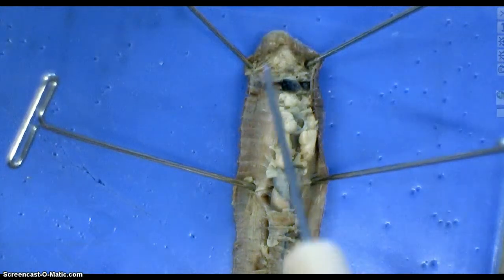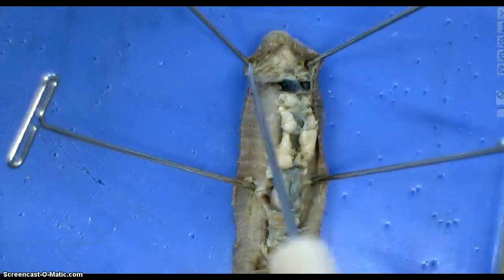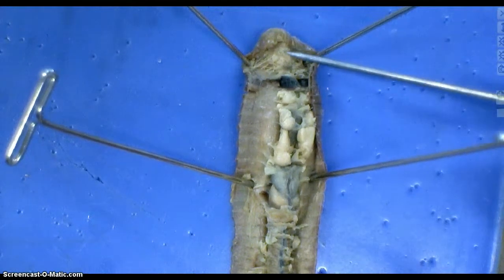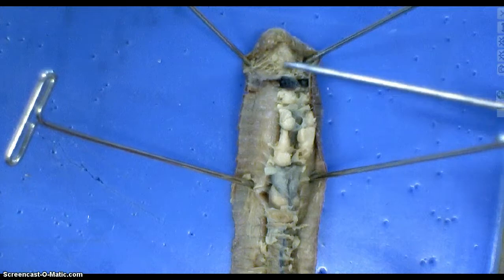You can see there's a lot of connective tissue still here. You can use your needle and cut that away if that bothers you, or you can ignore it. But when you feel it, it's going to be relatively tough because that's the pharynx.